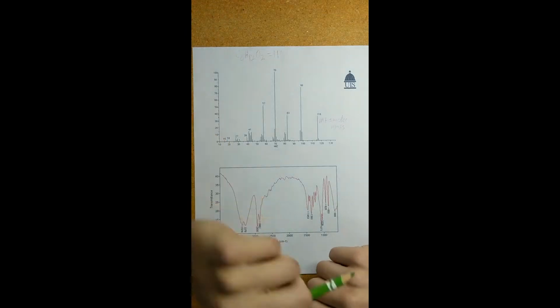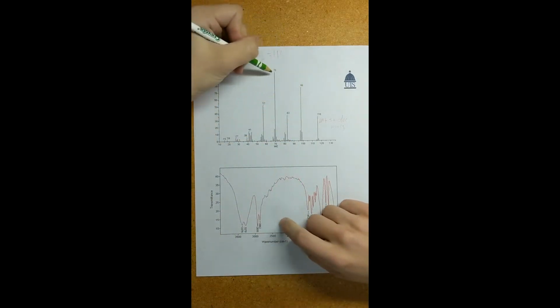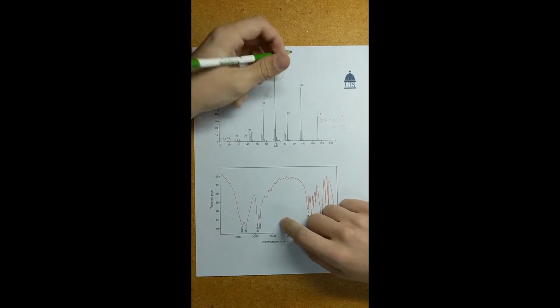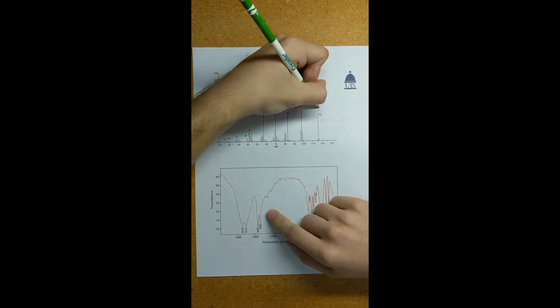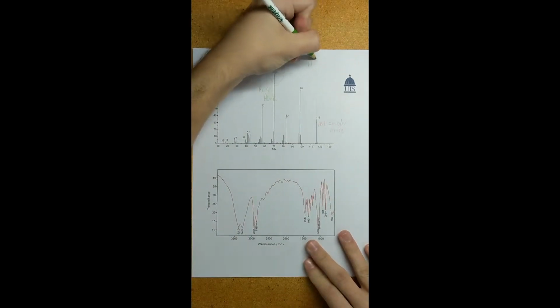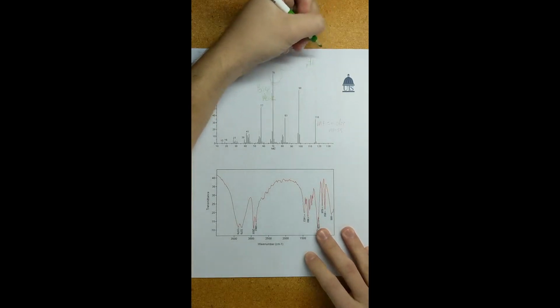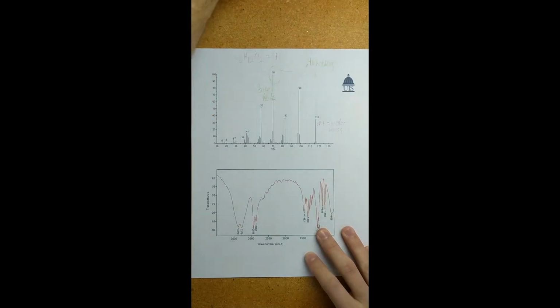Secondly, we want to label the base peak. Our base peak is always the highest peak in mass spec, so that's going to be right here with this number 70. Label that as the base peak. And we'll draw a little connecting line to our M+, just to know that that's there. The difference in the math there is 46, which, referencing Compound Chem and their mass spec worksheet, does not represent any particular structure. So I'm just going to write nothing there as a little side note.